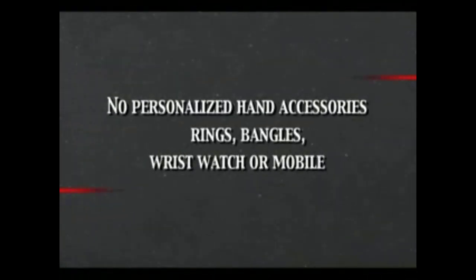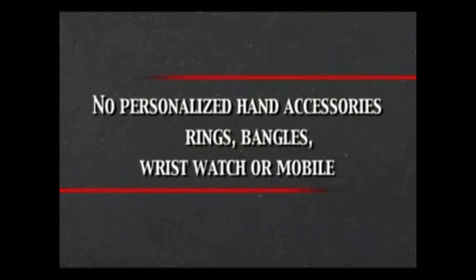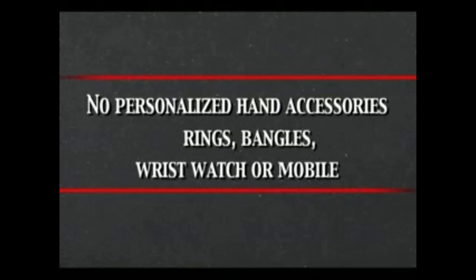Before starting the process of wearing PPE, ensure that there are no personalized hand accessories such as rings, bangles, wrist watch, or mobile on your person.